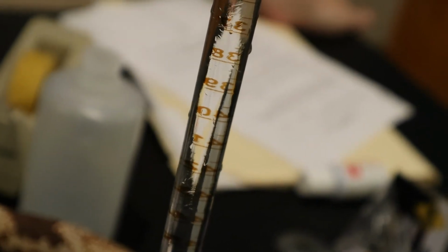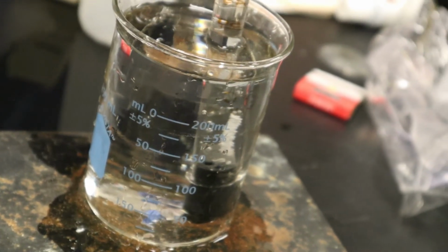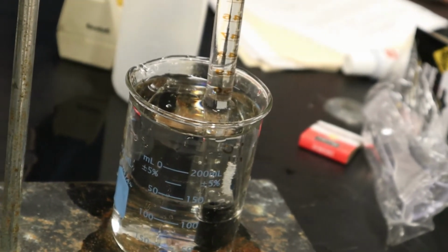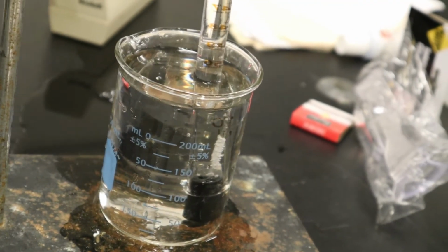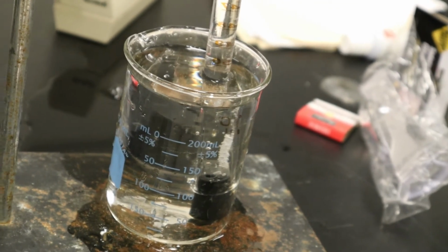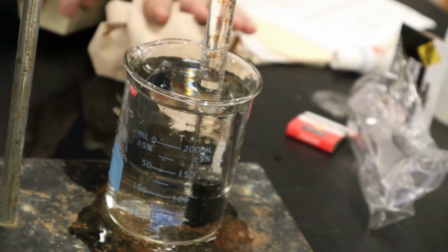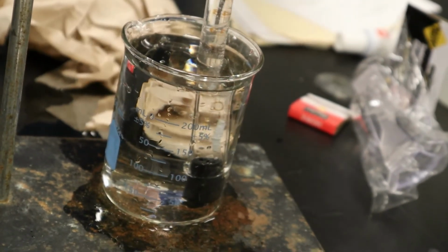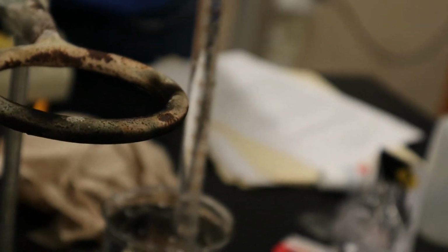And you will see, once the acid starts touching the magnesium, you'll see bubbling, and that's the hydrogen gas escaping. Okay, because you can see it starting to bubble. Now, we're gonna need some paper towels. Okay. So we're just gonna let the reaction go. Now, why is water coming out, okay? Well, now it's really starting to kick in. You see all these bubbles? That's hydrogen gas being produced.